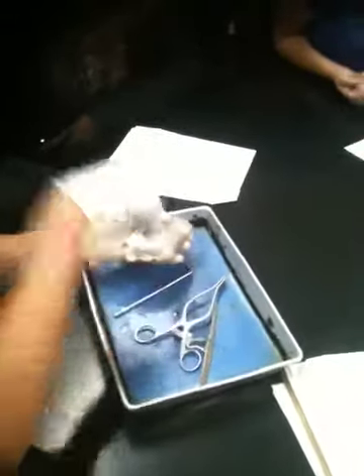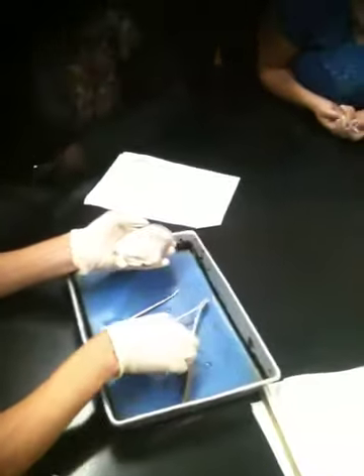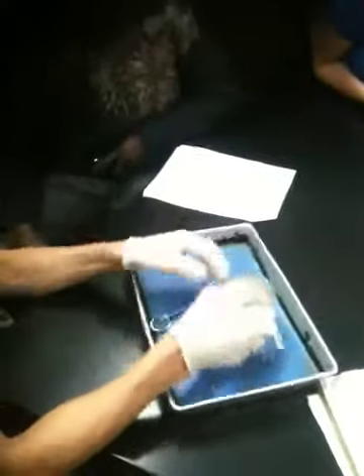Okay. All right, don't squish anything out of this. All right. You want a circle on this? What's on it? Oh, yeah.